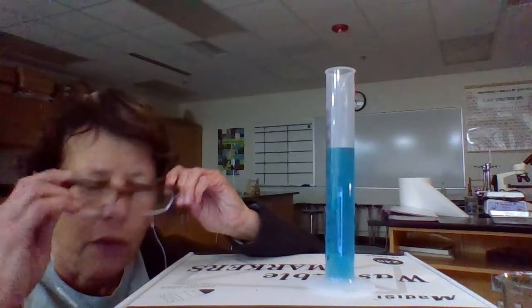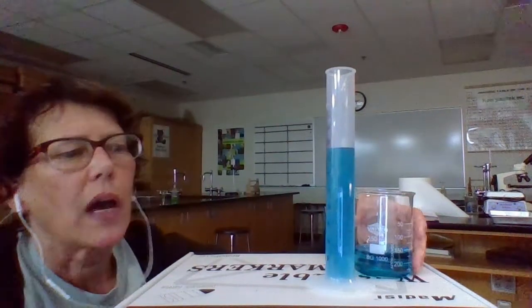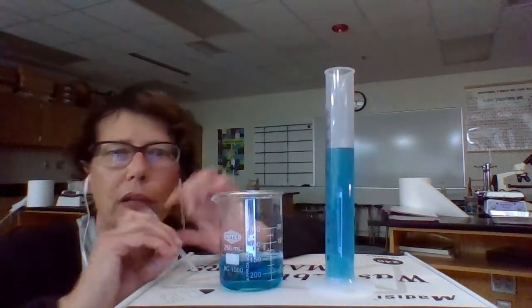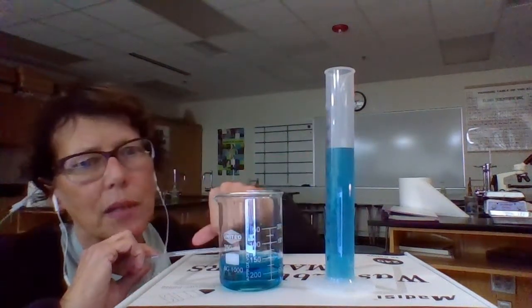Let's say for my experiment, I needed 80 milliliters of water, and I'm at 78. So I need to add more. So I could just pour some water in, but how lucky do you think I'd have to be to get exactly 2 extra milliliters in here to reach the 80? It'd be hard just pouring it from this. So that's why in science we use something called a pipette, a little eyedropper thing. And I can add smaller amounts of water so I can get to the 80 mark without overshooting it and having to dump water out.